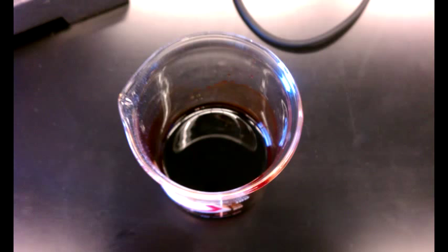By now, the beaker on the hot plate should be about done. If while waiting you notice the volume getting too low or if it has already begun to spurt, remove the beaker off the hot plate using a tong and transfer the beaker to the table.